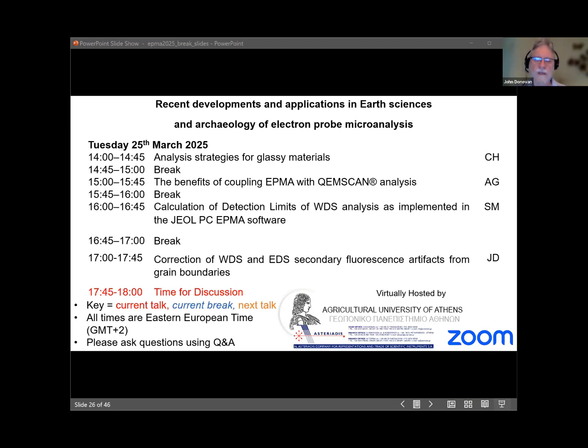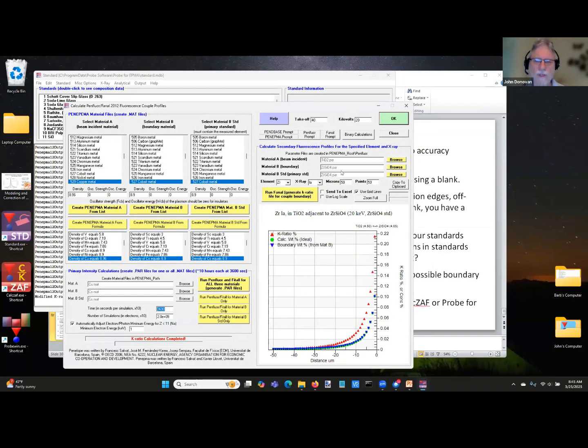But with this, am I still sharing my screen? Nope. Okay, that's the problem. You can share it if you want. Okay, thanks. So here, when you run the calculation, all these points, all these distances are calculated all at once, because it's using a simplified model for calculating fluorescence, but it's pretty accurate. You can see we did that iron nickel vertical boundary, and it works. The Bragg correction is a correction on top of that, and this inclined boundary is going to be maybe another correction on top of that. But the most important thing is just to run the model to begin with.